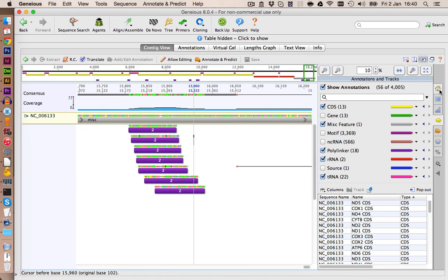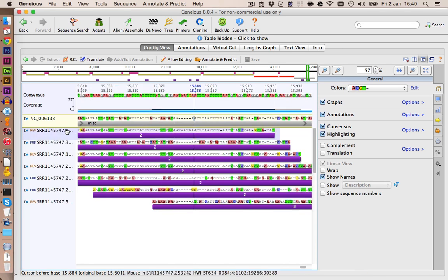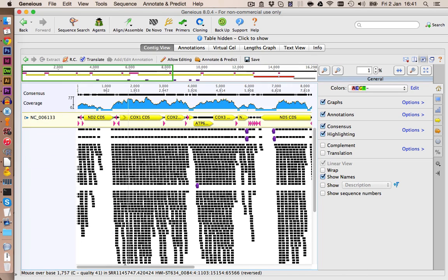It did find some matches over here, but those also don't look very reliable. We delete them as well. Alright, except for one spot, which was this one here, we didn't get a lot of new hits, which is a bit unfortunate. Could have two reasons.